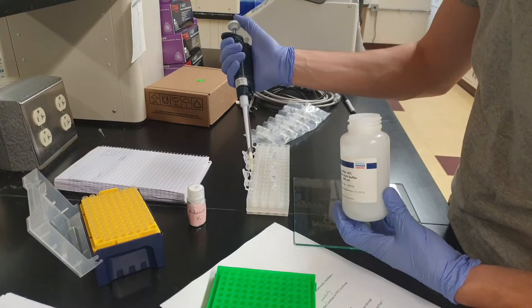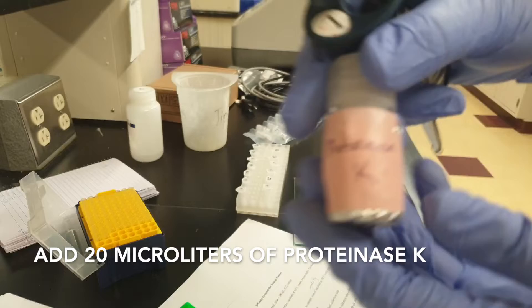After that, add 180 microliters of ATL buffer, then 20 microliters of proteinase K.